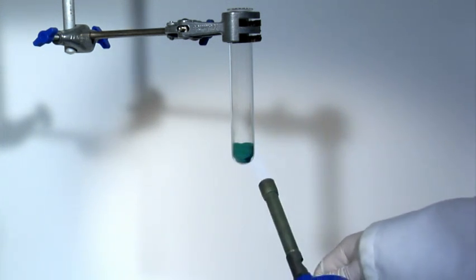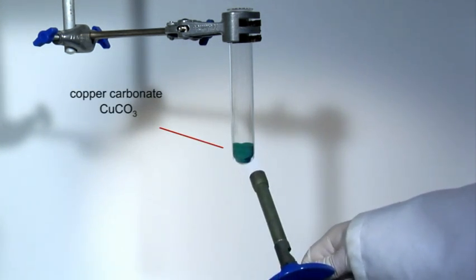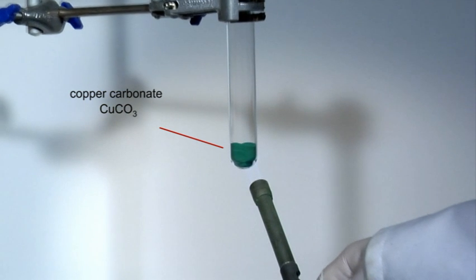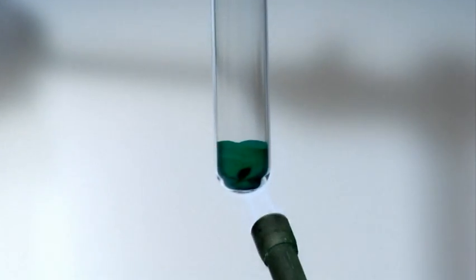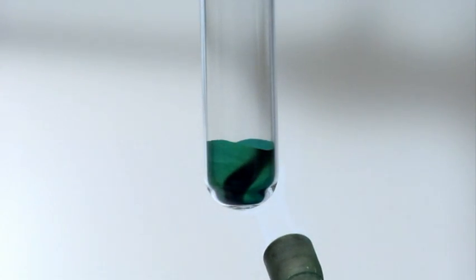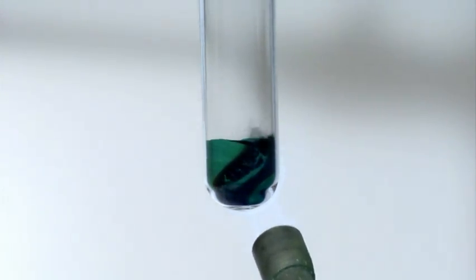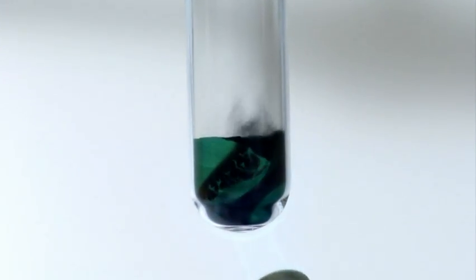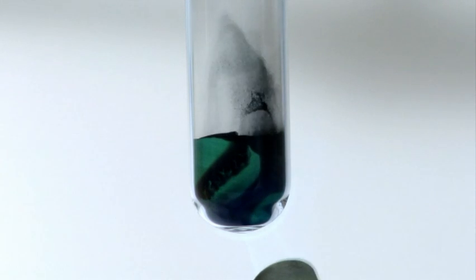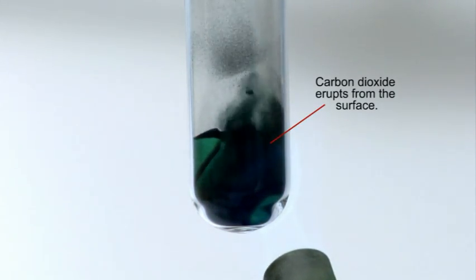Green copper carbonate decomposes around 200 degrees Celsius. The carbon dioxide gas produced in this reaction is evolved rapidly. In fact, five grams of the solid produces about one liter of gas at room temperature.